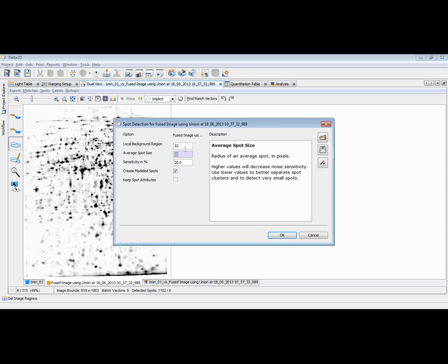So I can now play with these parameters, change them, and see how changes translate into different spot patterns. Let me, for example, change this to 50 so that I don't get very small spots, just big ones. If I then later think, oh, this hasn't been a good choice, and I would like to get back to the original parameters as they have been estimated and proposed by Delta2D, then you can just click this button and you get back the original parameters that Delta2D has taken from this image. Let's try the spot detection with these parameters.